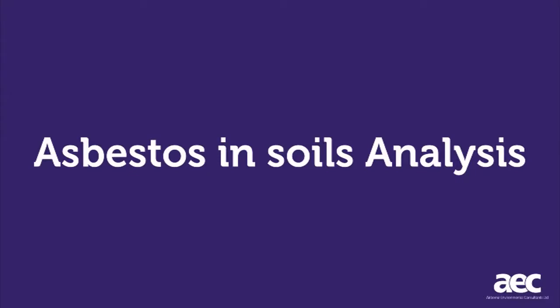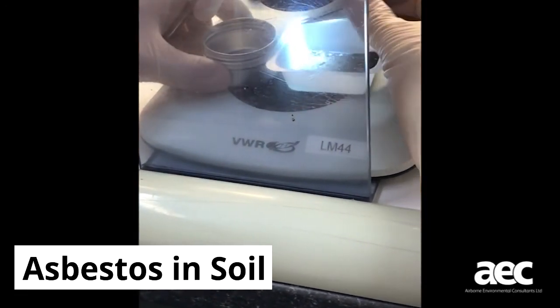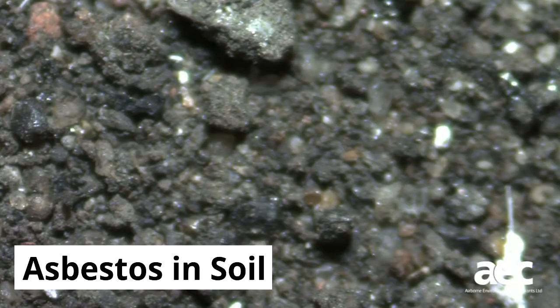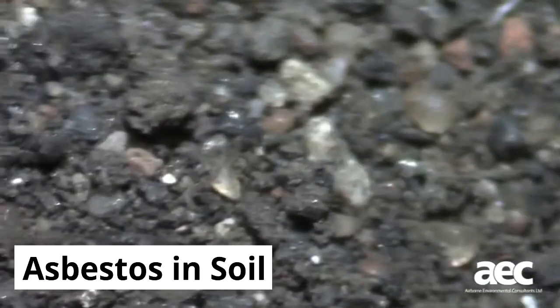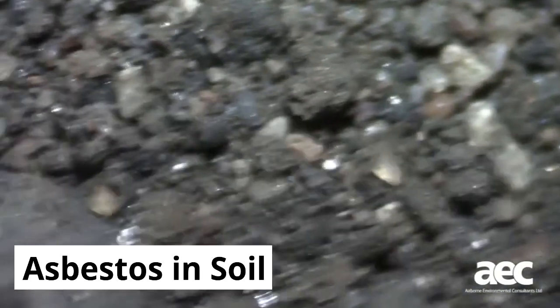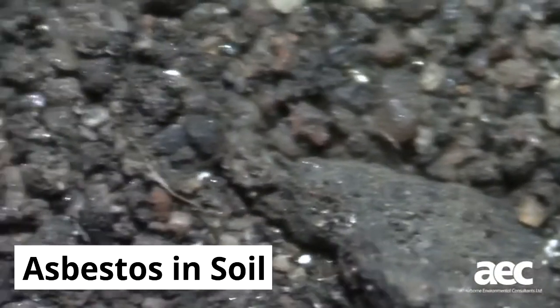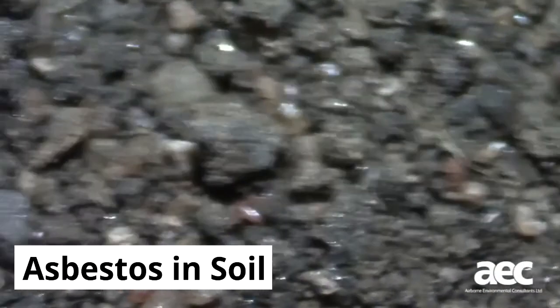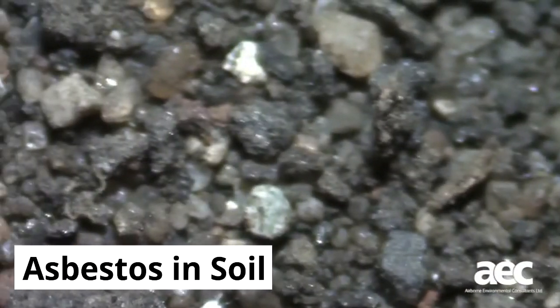At AEC, we also analyse soils for asbestos and are working with BOHS to develop training courses for the analysis of soil samples. The process is an extension of standard bulk analysis and involves assessing soil samples under the stereo binocular microscope after the material has been dried and prepared. AEC offer all three recognised levels of analysis.